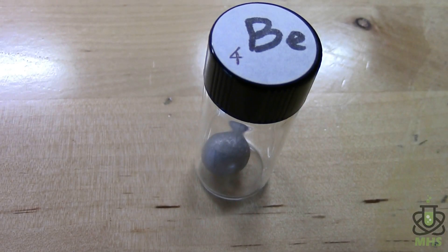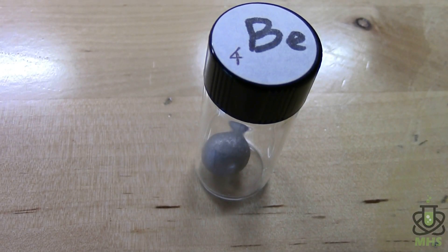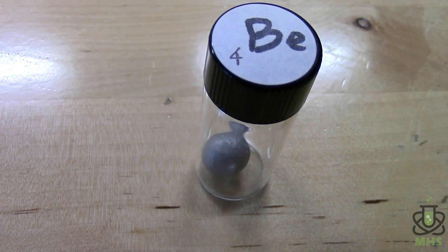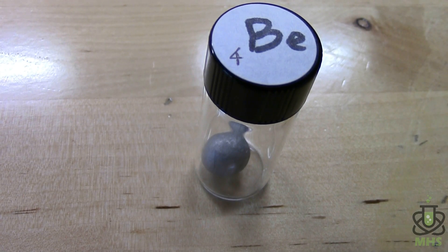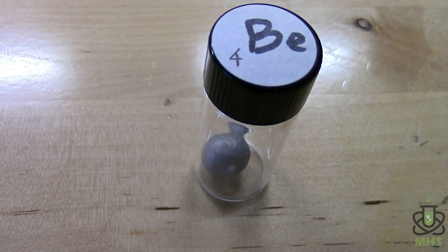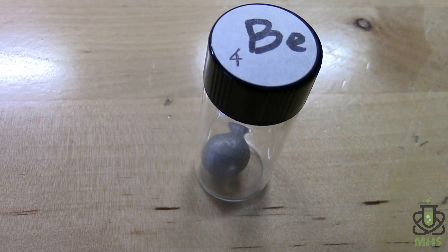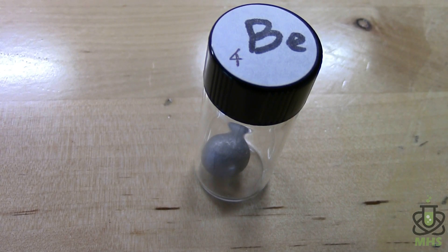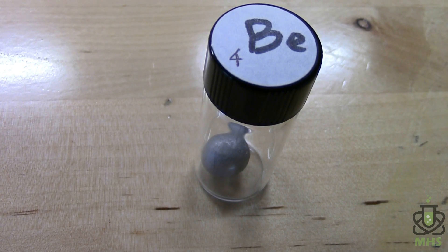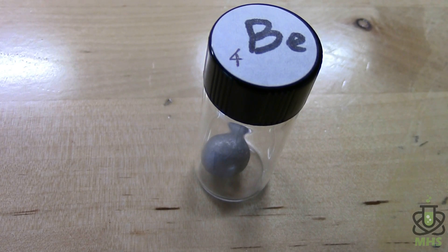Hello everyone and welcome to the next installment of the Elemental Extractions series. Today we're going to be going over beryllium. It is the first of the alkaline earth elements, which are all somewhat reactive although less so than the alkali metals — we went over lithium in the previous video.